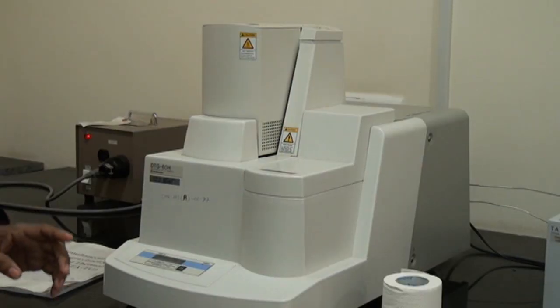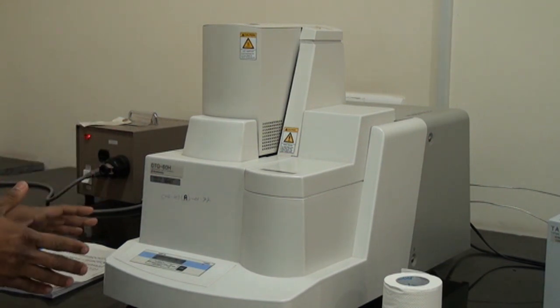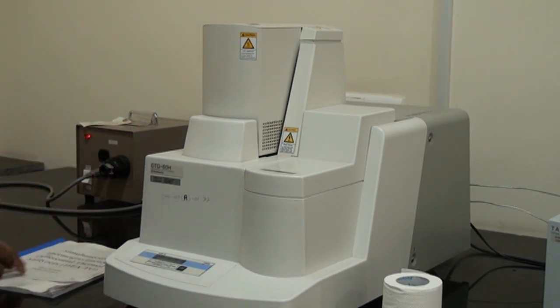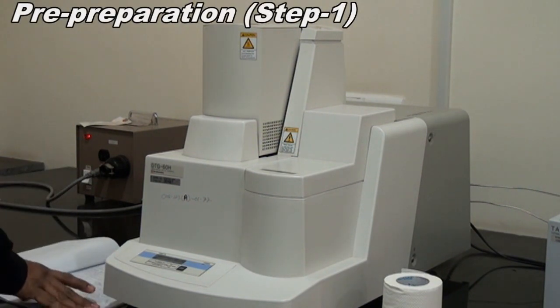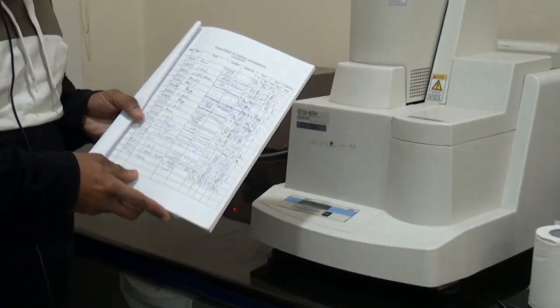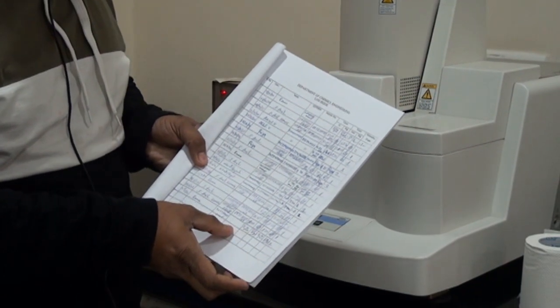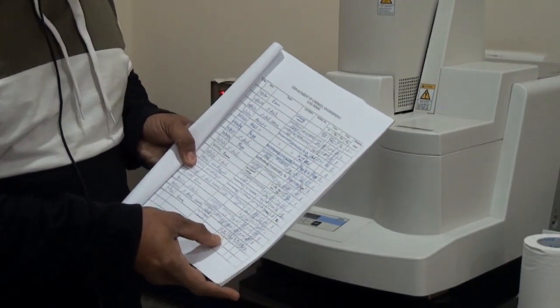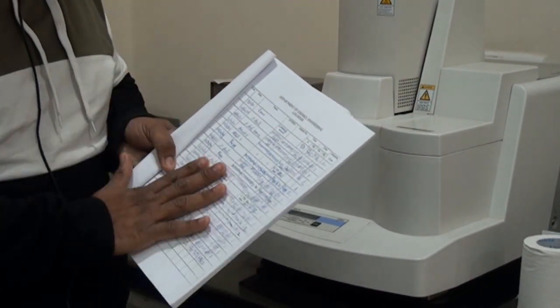Once you have logged your details in the lab, you have to come to the DTA instrument. Here the DTA logbook is placed, and again you need to enter your details: the date you are conducting the experiment, your name, ID and mobile number, and what time you start the experiment and what time it ends. Those details you have to fill in your logbook.